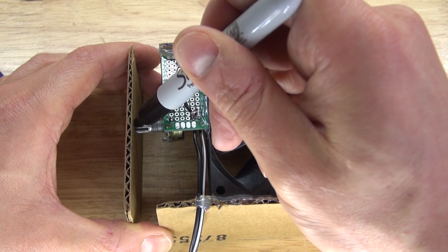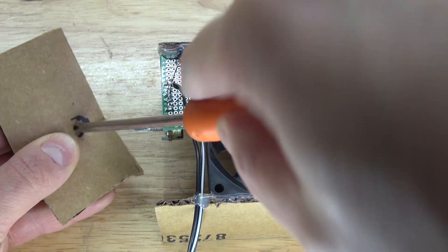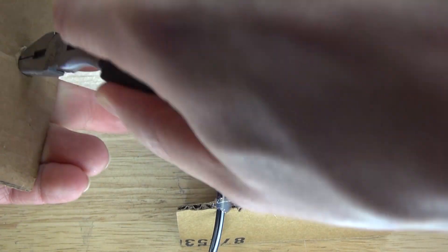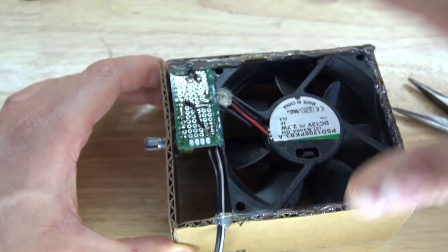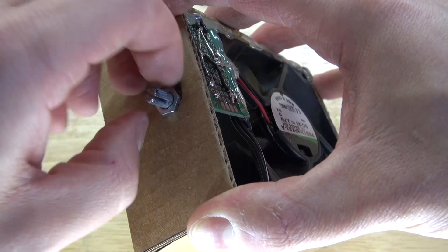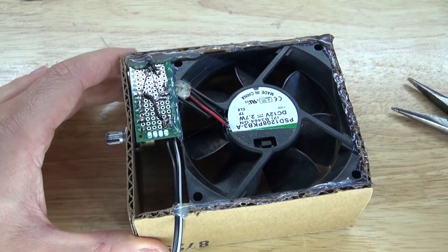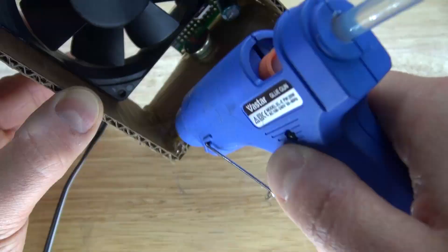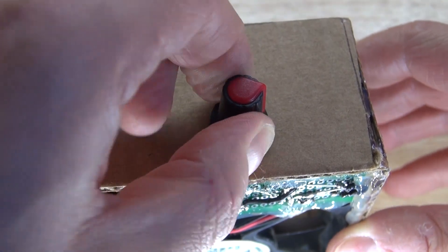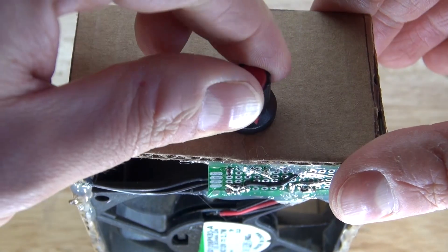Now I'm making a mark for the front panel so I know where the potentiometer is going to come out. Make a hole, then make it a little bit bigger for the potentiometer to slip through. The potentiometer fits. I'm going to place the washer on the potentiometer, then the panel, then the nut. Put some hot glue to glue the front panel to the circuit, and glue in the corners to make it extra secured. Now it's time to place the knob — push the knob into place, holding behind the potentiometer so it doesn't bend and break. It's connected just like that.